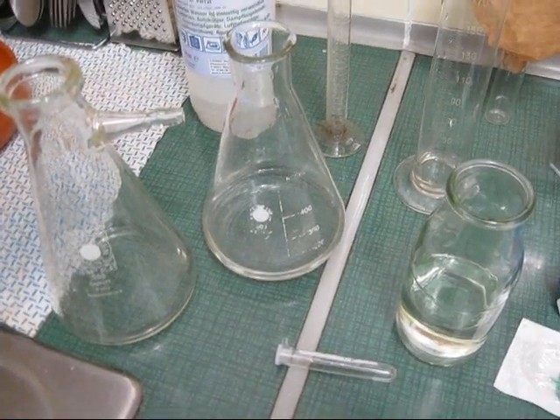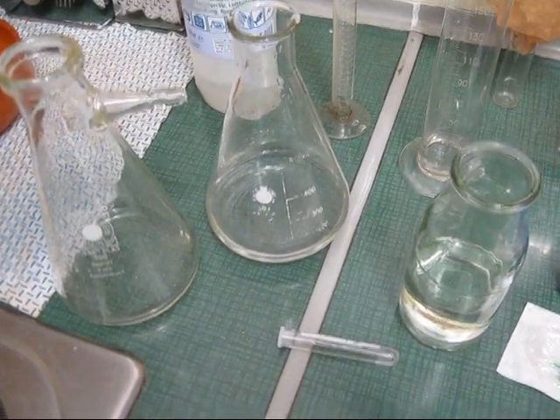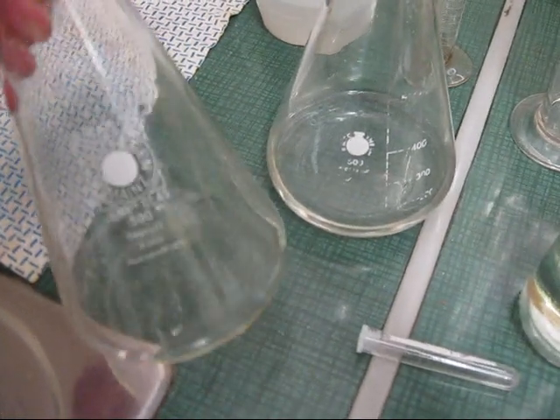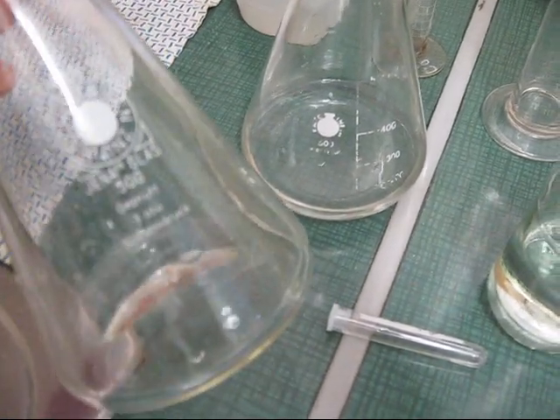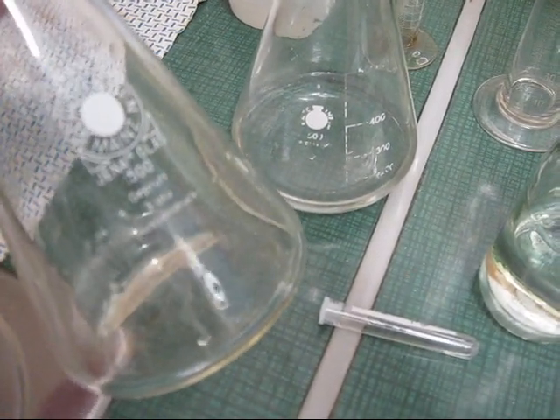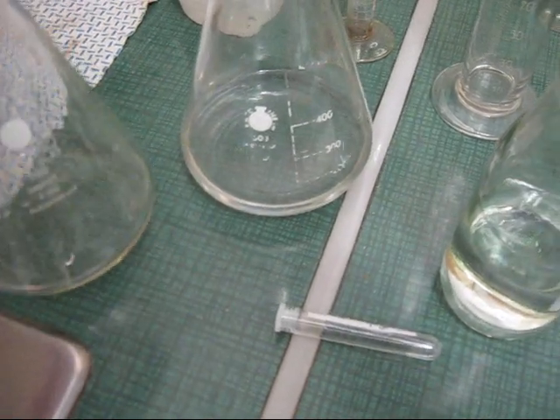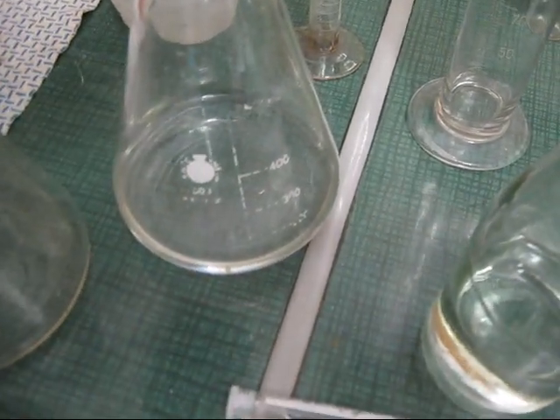Okay, so I decided to redo my kitchen DNA extraction experiment. Here I have 20 milliliters of distilled water with 1.5 grams of sodium chloride. That is just table salt, sodium chloride.